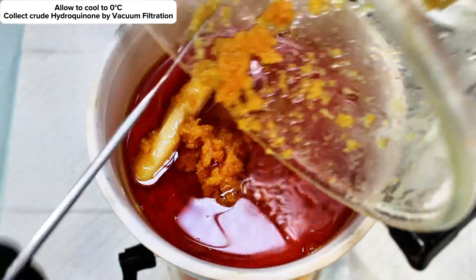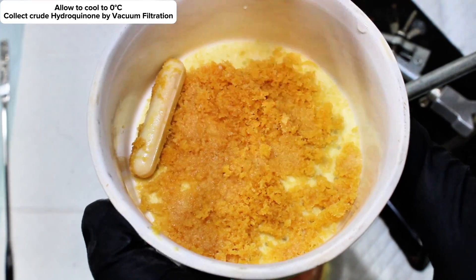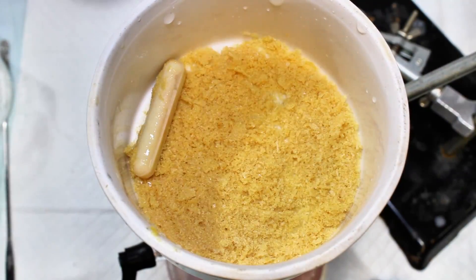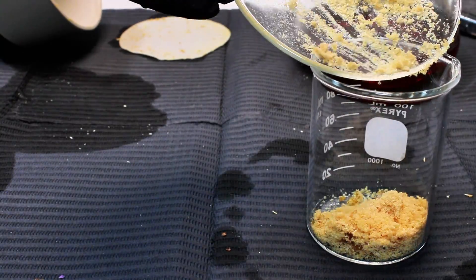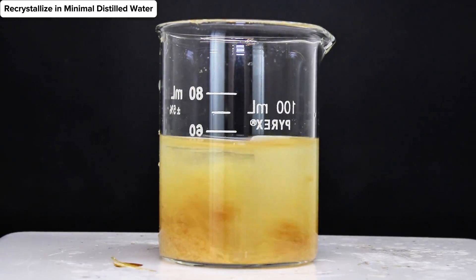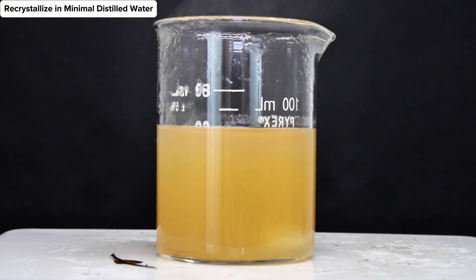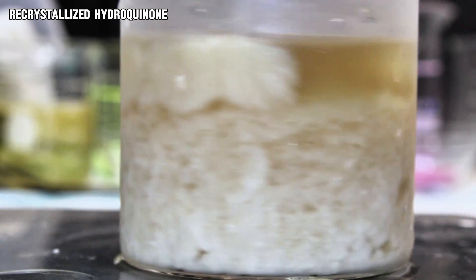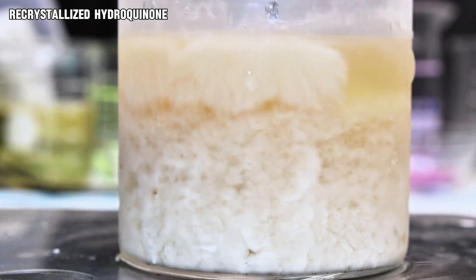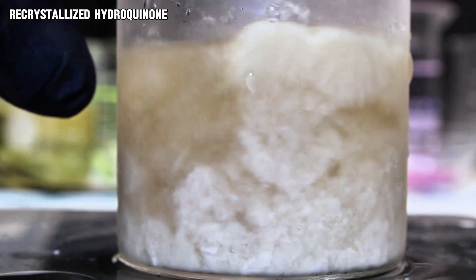After allowing the two to react for about 20 minutes, I took the beaker off the hot plate and placed it in an ice bath to cool down to zero degrees Celsius so that the hydroquinone could crystallize out. The crude hydroquinone was collected by vacuum filtration, rinsed thoroughly, and then transferred to a small beaker along with around 50 milliliters of distilled water. This was brought up to a boil to allow all of the hydroquinone to dissolve, and then cooled down to freezing to crystallize it back out. The resulting crystals were again collected by vacuum filtration, dried, and weighed for a final mass of 4.83 grams, representing a 46% yield from benzoquinone and a 33.2% yield from the paracetamol.